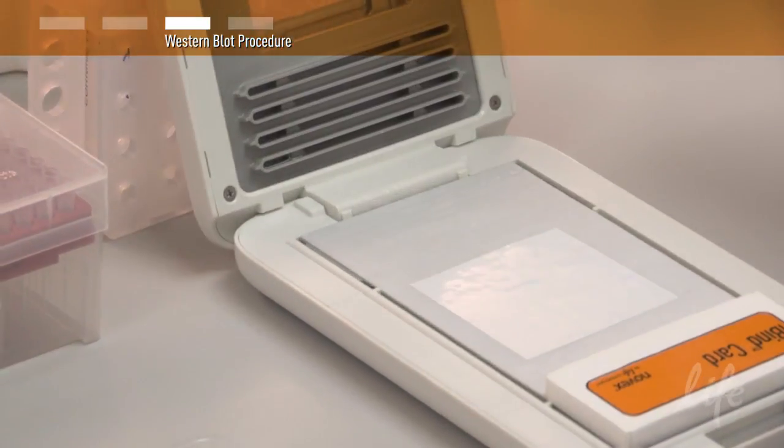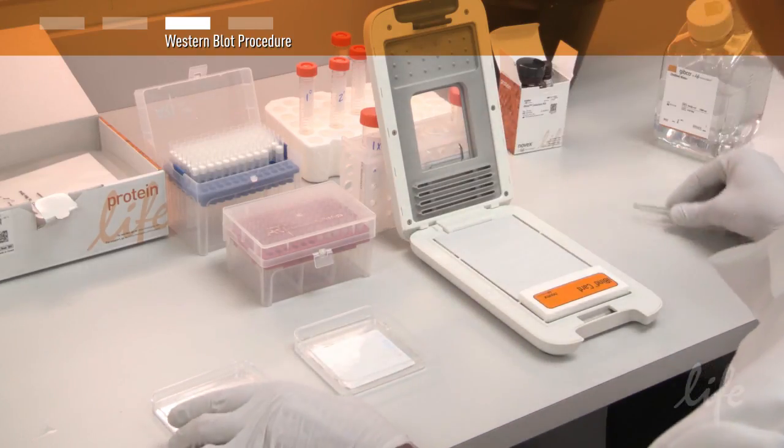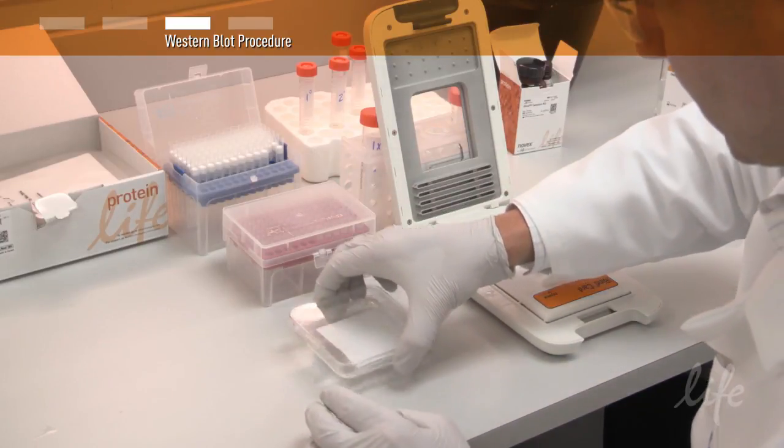After incubation, rinse the membrane in water, discard the used iBind card, and proceed to your immunodetection protocol.